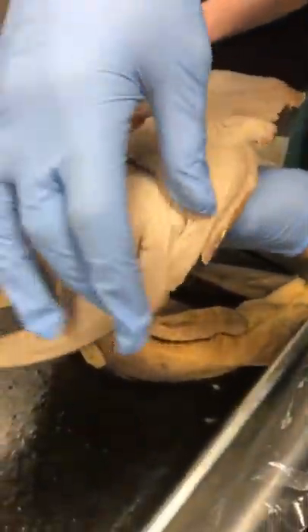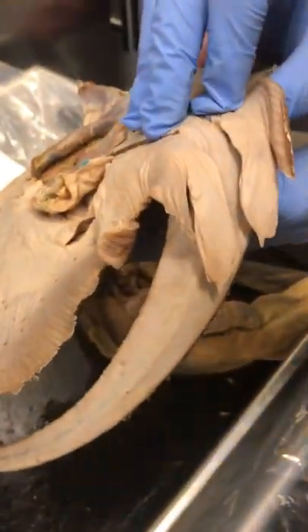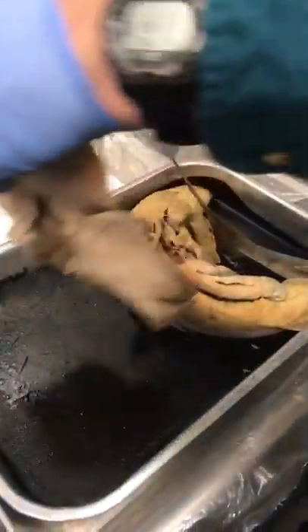You can find the same kind of spiral valves here inside the stingray as well. And same general idea with the graspers — you can find the same form right here. So that covers this creature.